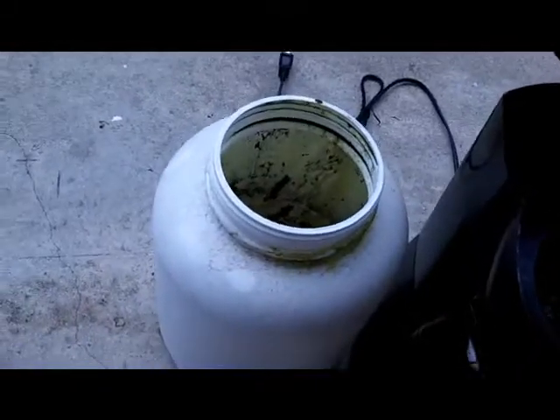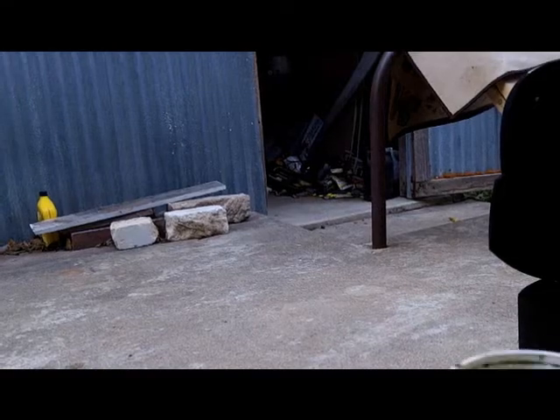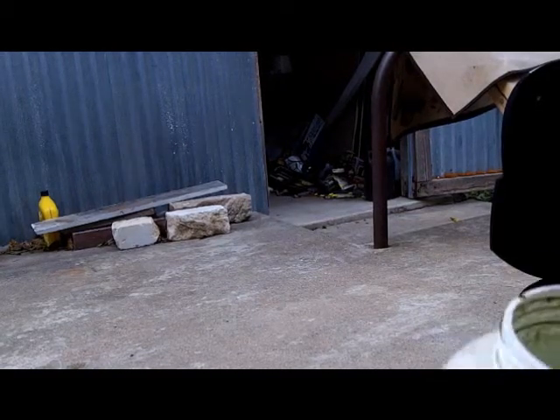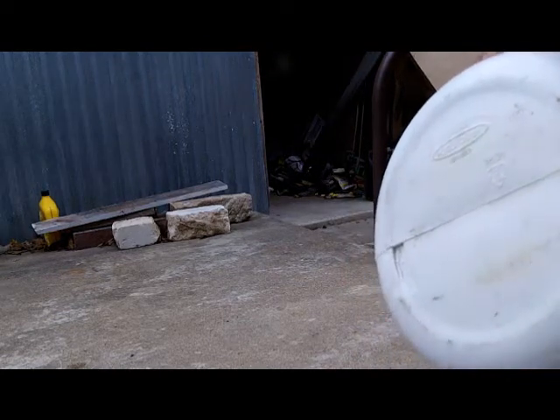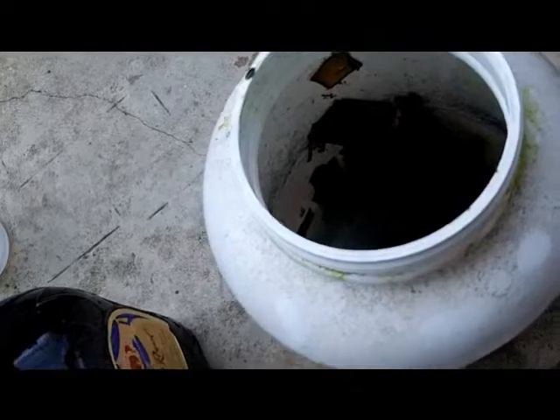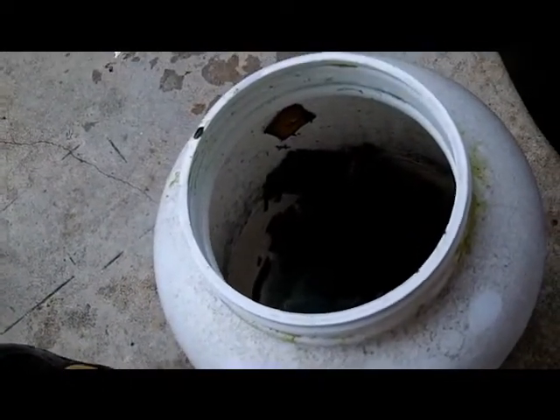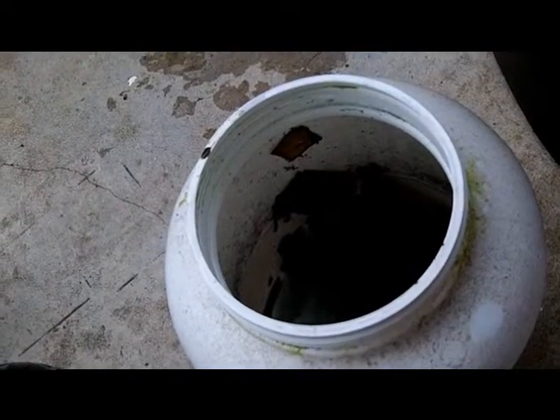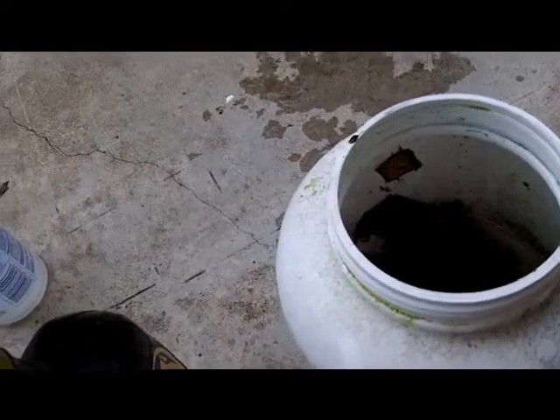This could be boiled down some too. I'm going to rinse some of this with distilled water. Now that the acid is pretty well diluted, I can even reach in there with my hands — maybe put some rubber gloves on — but I'll get the big chunks out, get them where I can squirt them off to wash off any gold that might be on them, and try to wash as much gold as we can get into the filter paper.